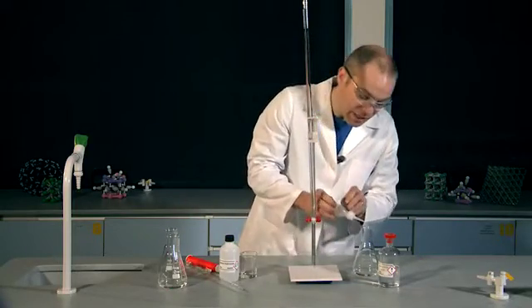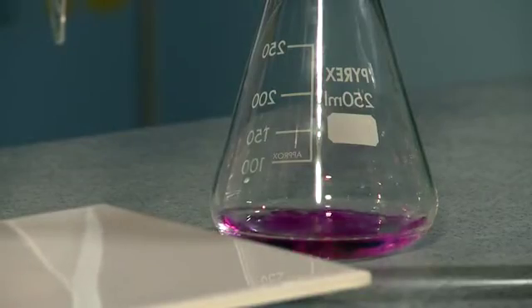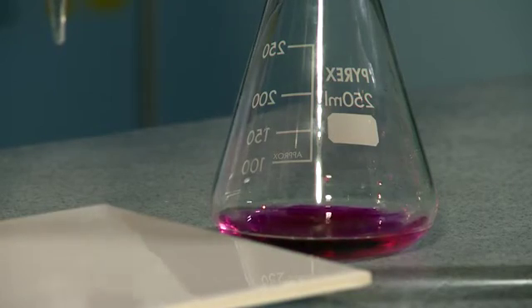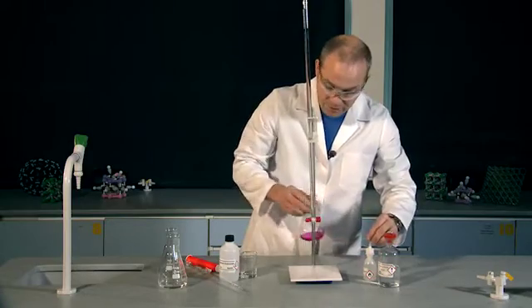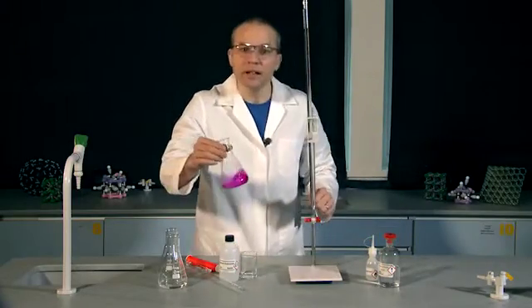I need to add the same amount each time for each titration, so I'm going to go for four drops. Give that a swirl. There's that bright pink colour.